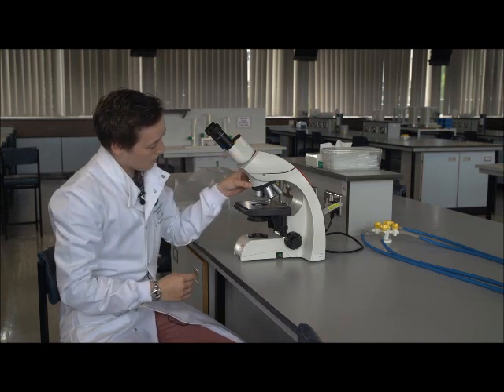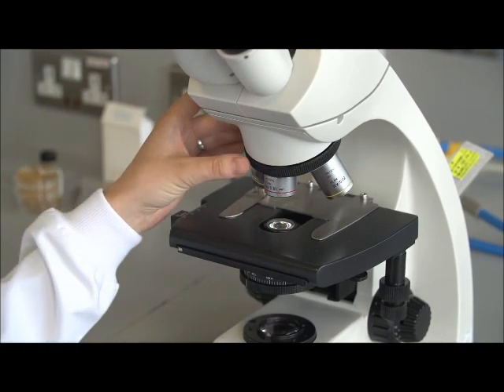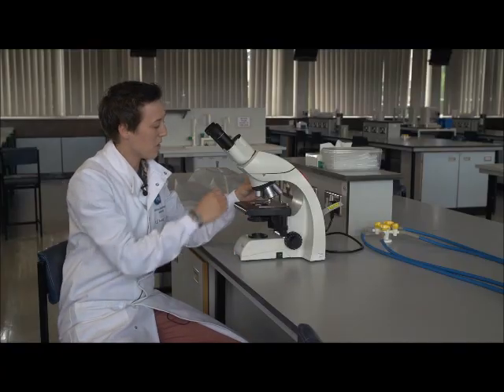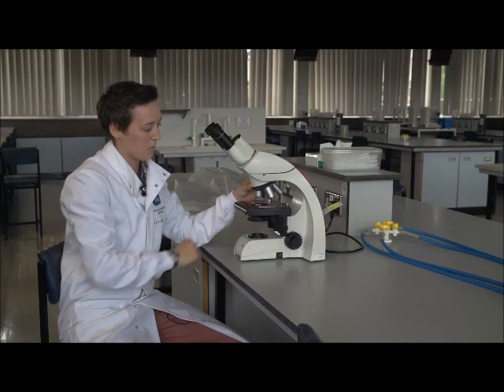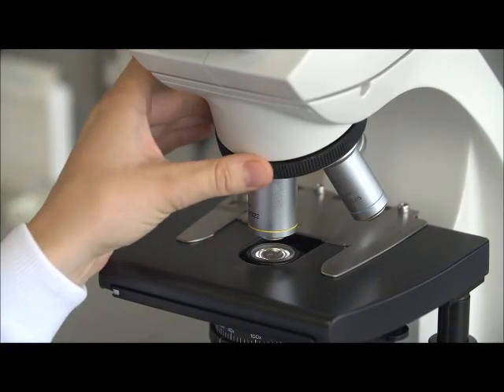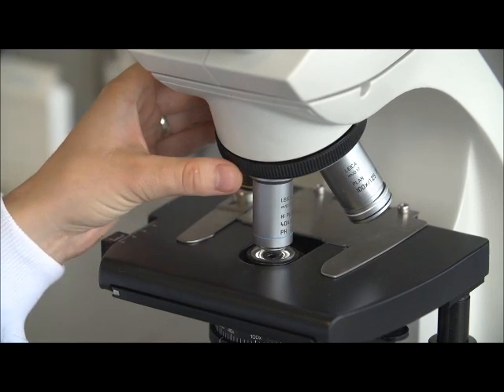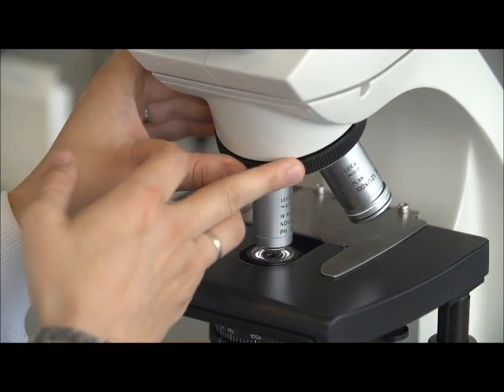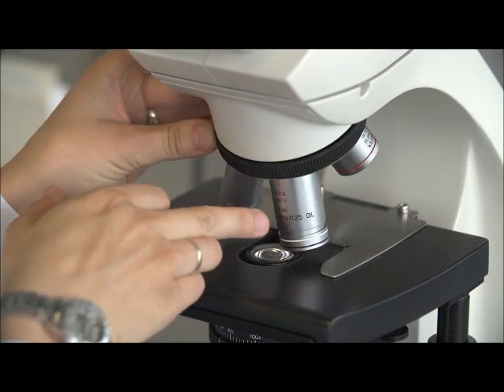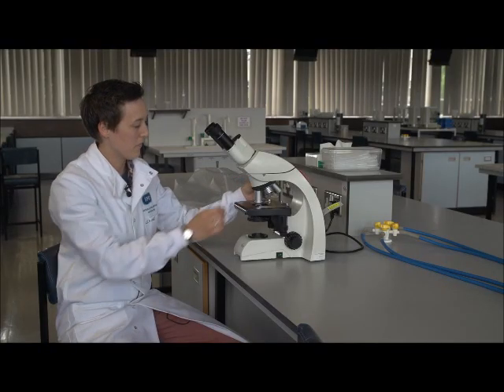Next we come down to what we call the nose piece, which is where all of the objectives are kept. On this particular microscope we have a 4x objective, we have a 10x objective, we have a 40x phase objective that I'll come back to and tell you some more detail about later, and also a 100x objective, and that requires oil immersion to use.